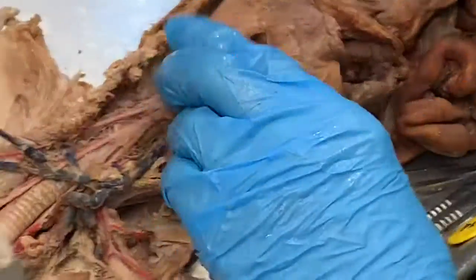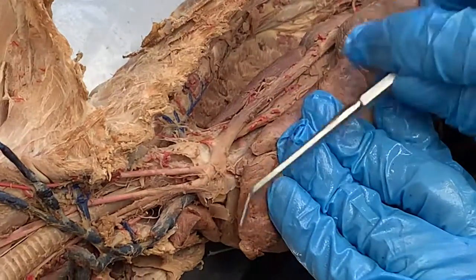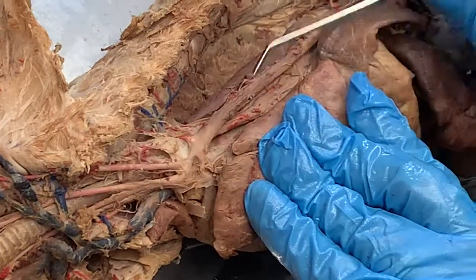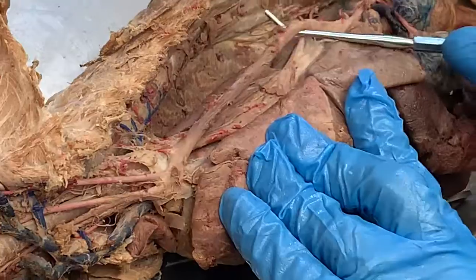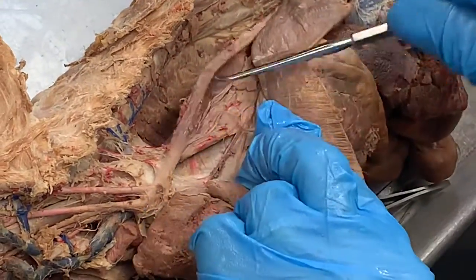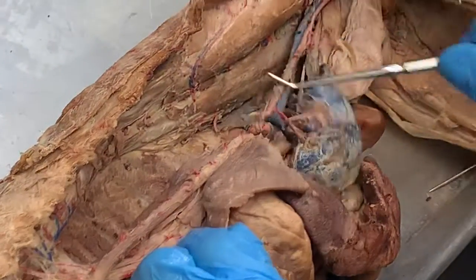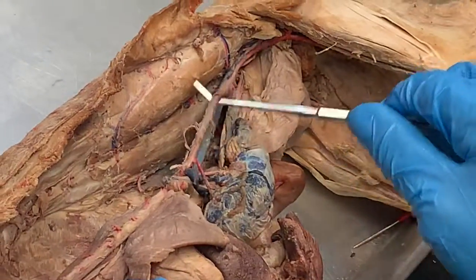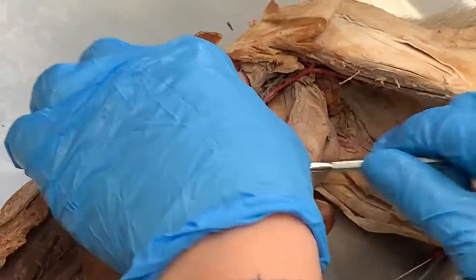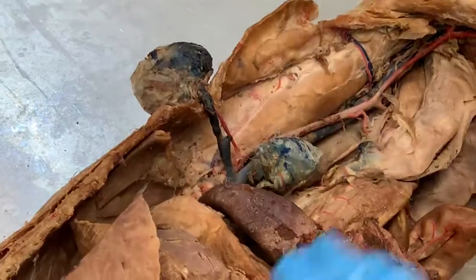Following the arch of the aorta down into the thoracic cavity, I'm gonna pull everything this way. There's the arch of the aorta. That's gonna become the thoracic aorta here. It's sitting superior to the diaphragm, so it's the thoracic aorta. But down here, inferior to the diaphragm, it's gonna be the abdominal aorta. There's a branch that goes off to the kidney. That's the renal artery there.